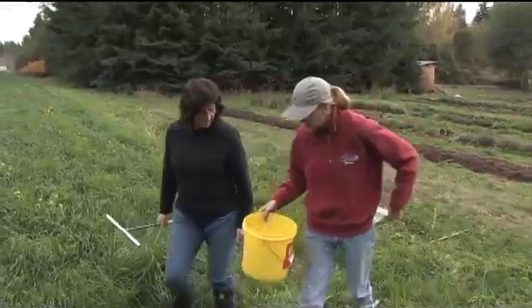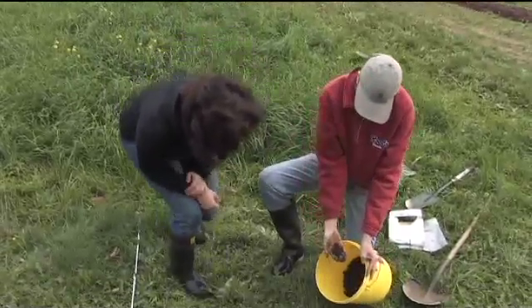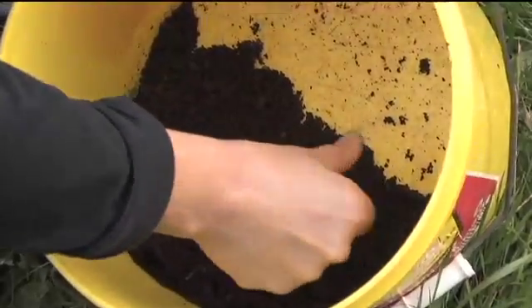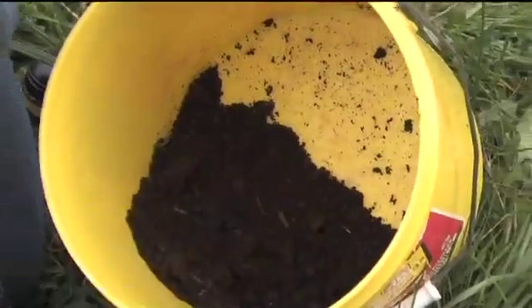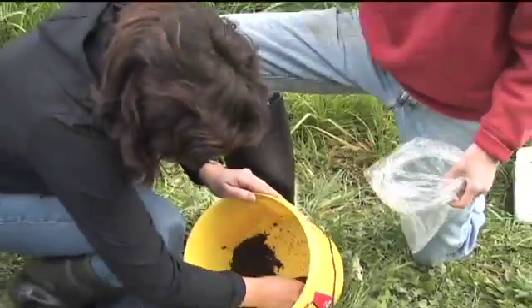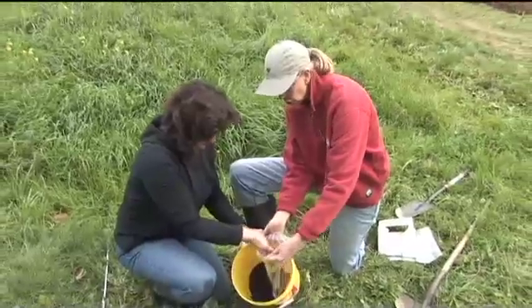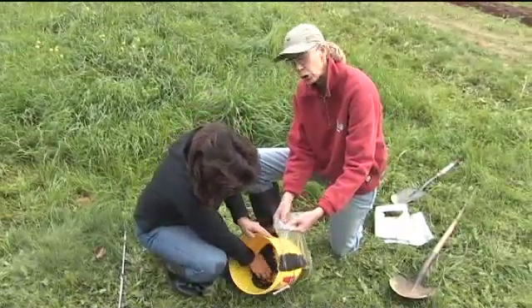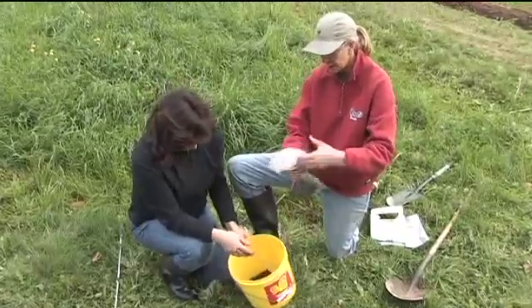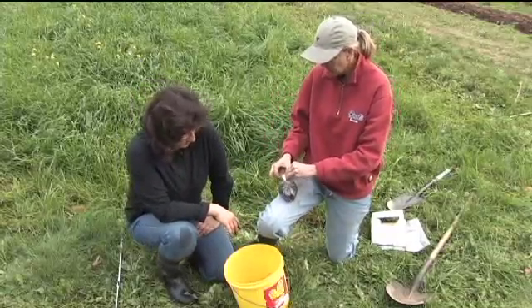For each transect, we pick out the grass and break up the core material. You can actually see the pieces of the core — we want to break that up with our hands, break up any clods, and pick out any rocks or grass. Once it's well mixed, put it into a sample bag — a nice composite sample from each transect, so we'll have five different samples altogether. We're handling this with our hands because we're doing nutrients. If we were doing carbon dating, we'd have to be very careful not to touch the soil, so we'd wear gloves and use special sampling procedures. But for nutrients, this is perfect.